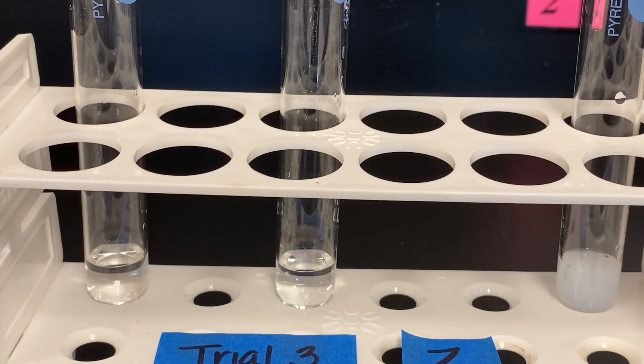The next step after listing each trial, trial 1, trial 2, and trial 3. Ensure that you have documented your reactions every time we experimented with a mixture. Trial 1 should have 3, trial 2 should have 3, and trial 3 should also have 3 observations.